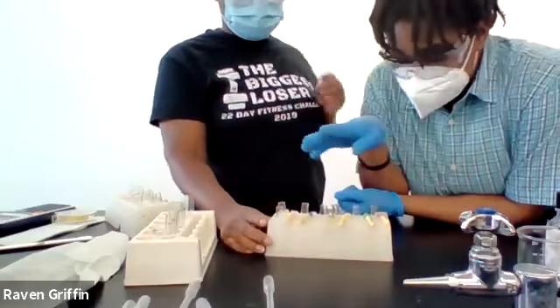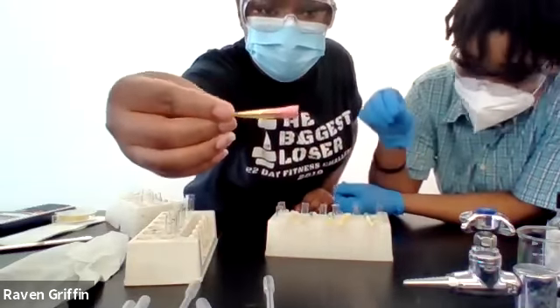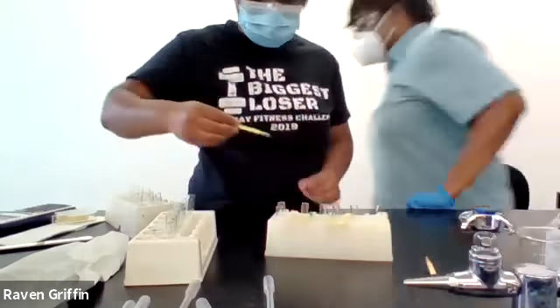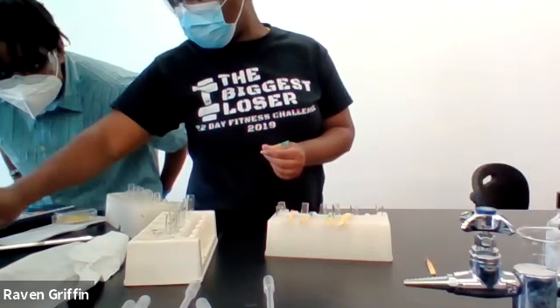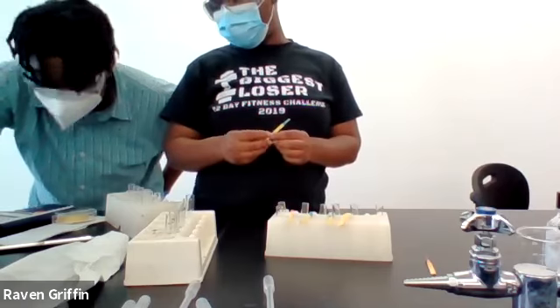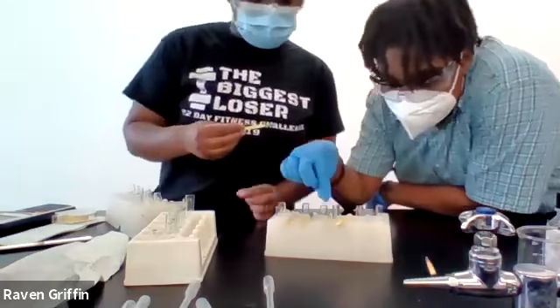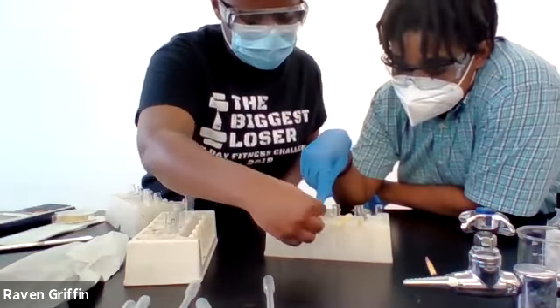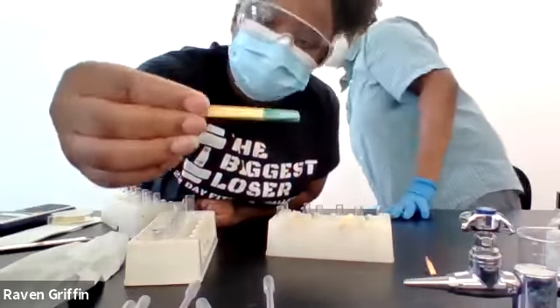Part C, we were testing pHs again with iron chloride. That's this purplish color. Okay, C. Sodium carbonate. No, they're in order here. So that's here. So this is the sodium carbonate. It's like a greenish color.